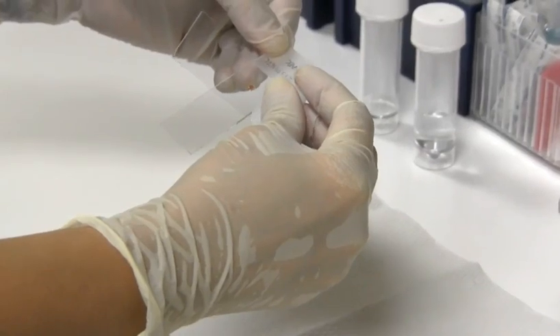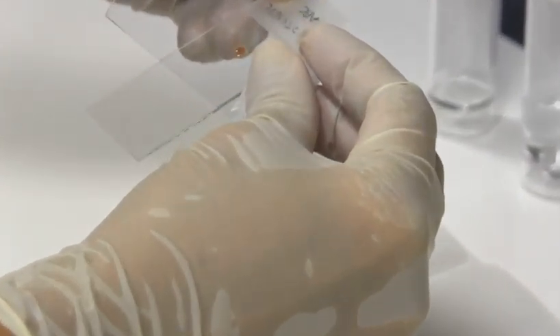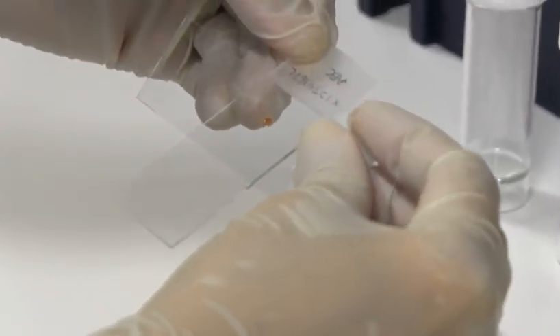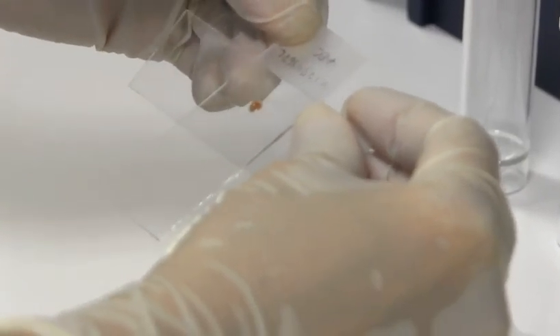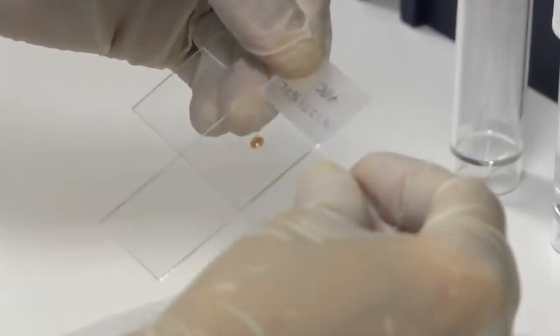Place the edge of the spreader slide that's closer to you, just gently down on the slide, perpendicular to the base slide. And then use the weight of the slide to spread out the material.